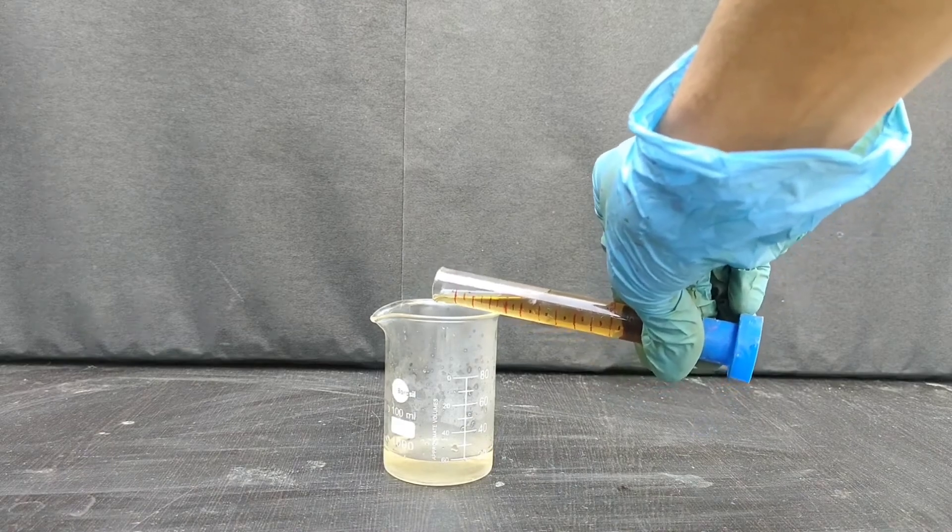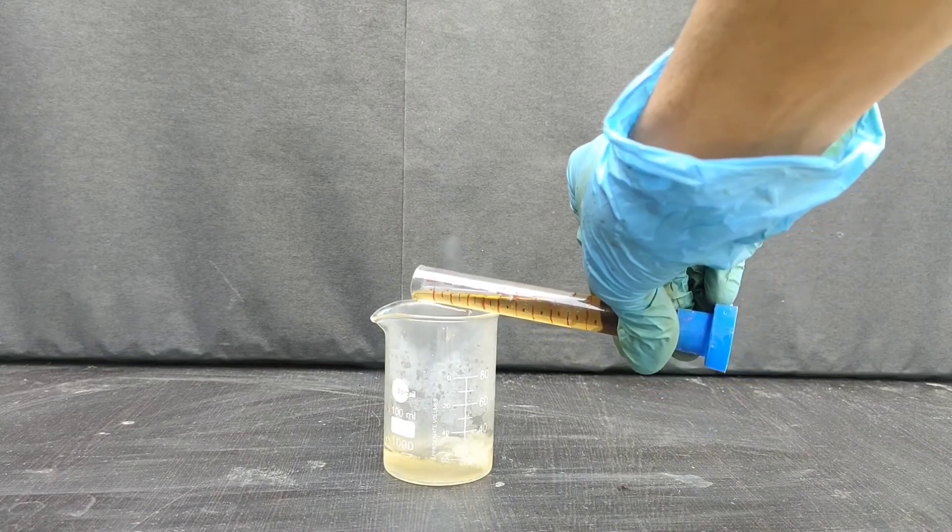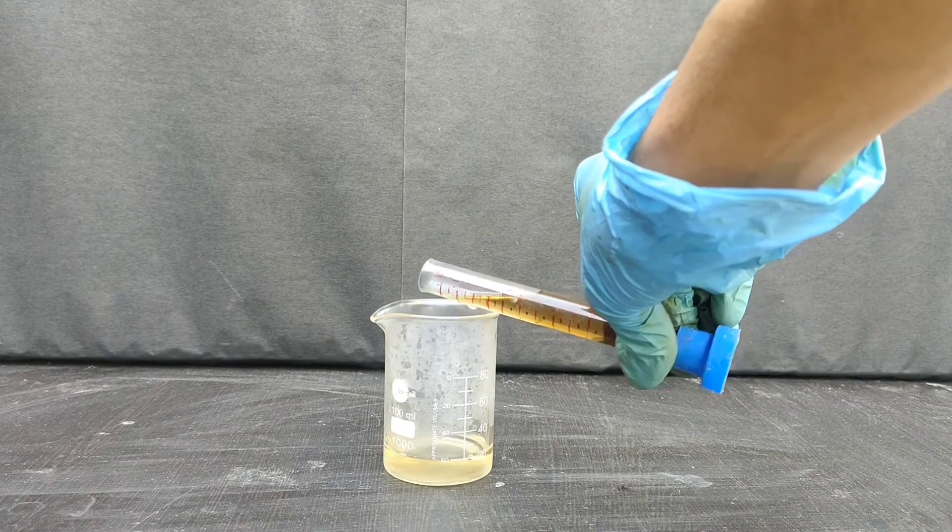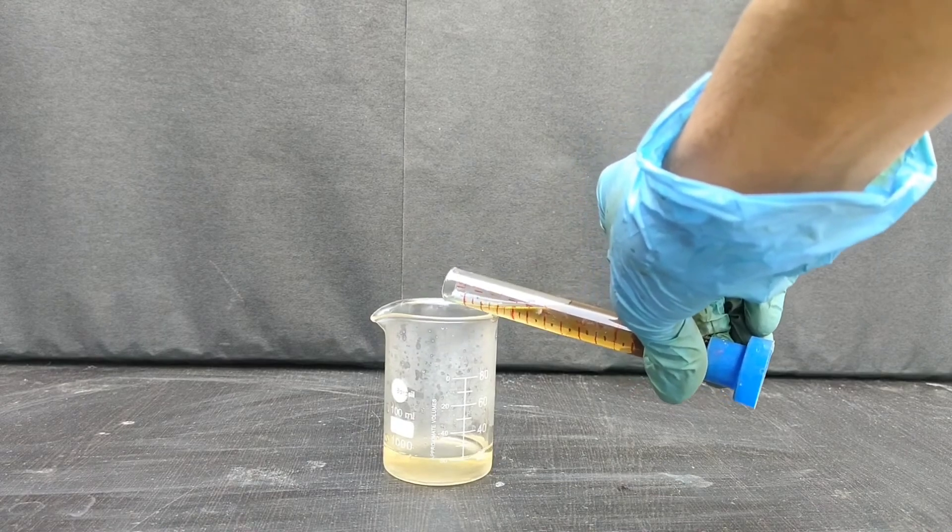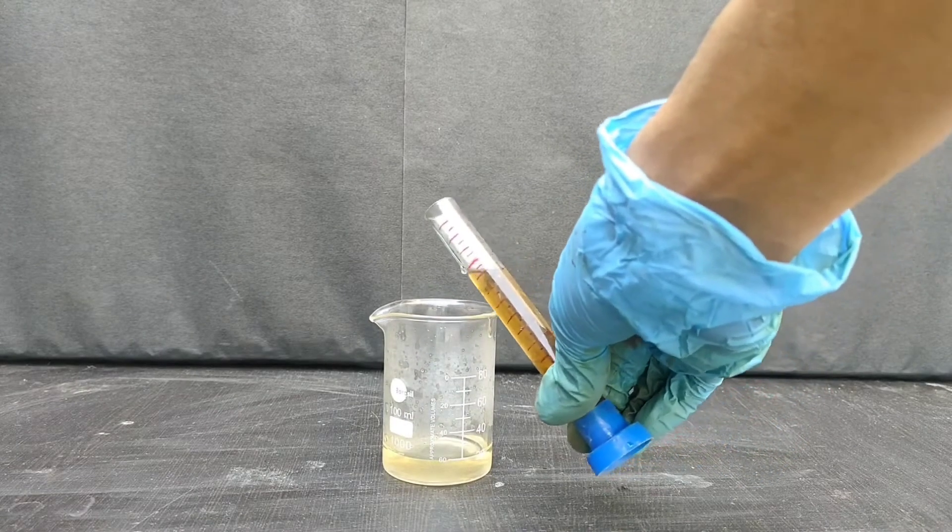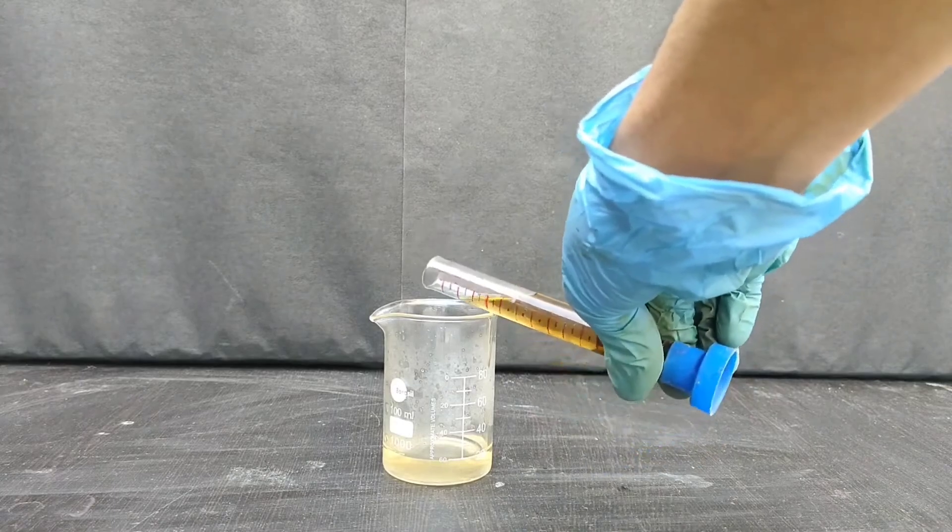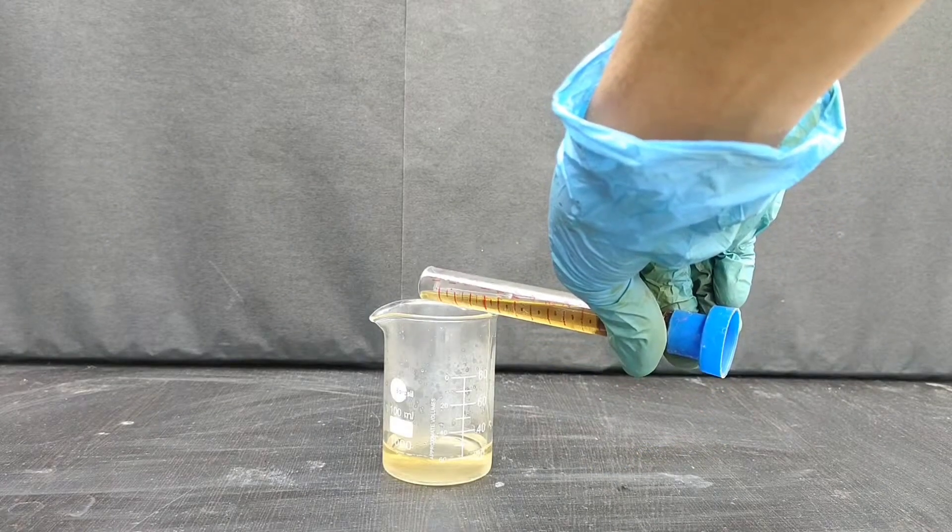You can see that on adding sulfuric acid to water, water starts boiling. Since the reaction is exothermic, we have to slowly add sulfuric acid.